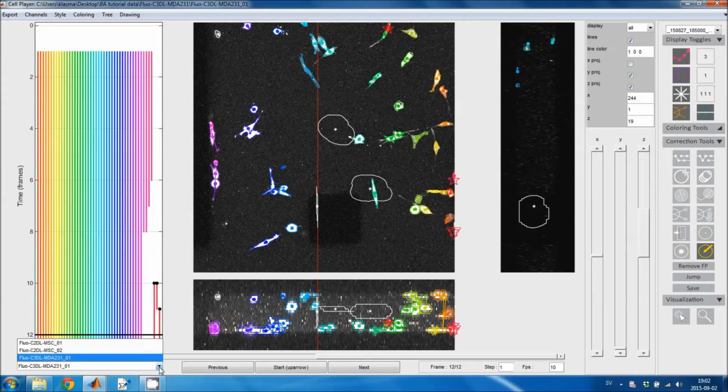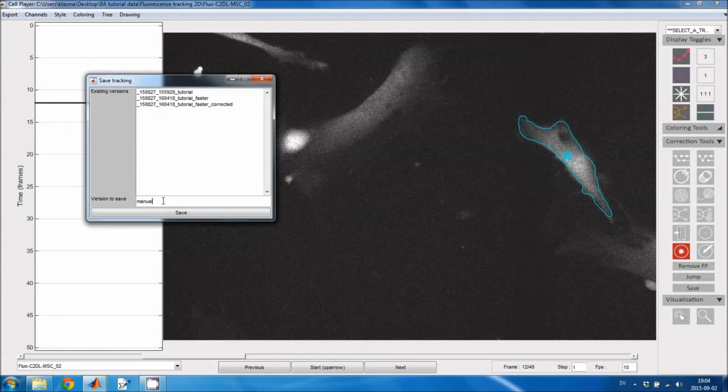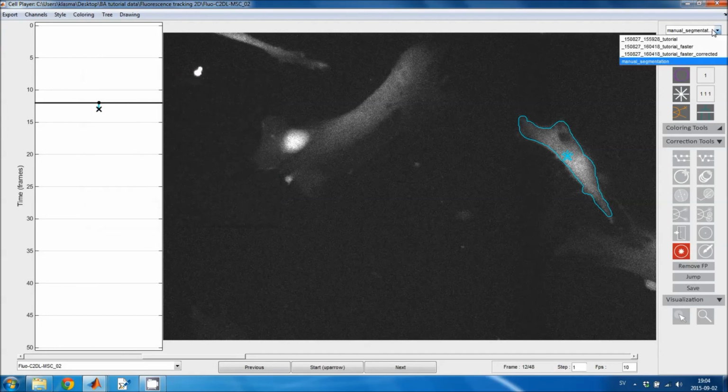And now I'll go back to the 2D view to show that you can create objects even without having a tracking result. I can just start drawing, and in this case it's going to be like performing the segmentation completely manually. That can be useful if you want ground truth segmentation for some purpose, or if you just haven't found a segmentation algorithm that can segment your particular cell type or imaging condition. So I'll just do one cell here and save it as manual segmentation. And now this tracking version appears here.